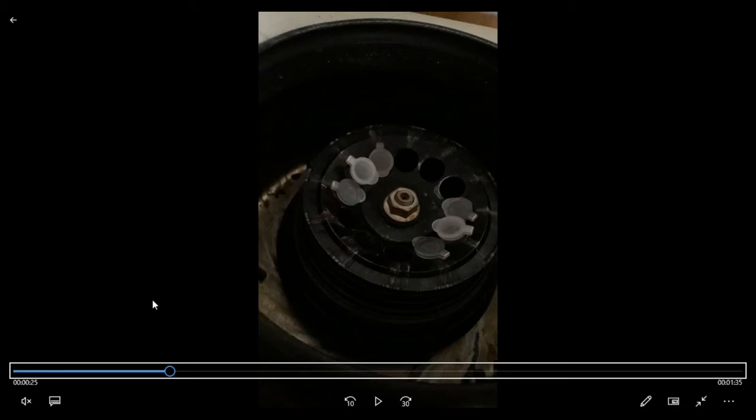if these tubes are not in a symmetrical or even position, the centripetal force will be irregular at the places where they are not symmetrical. That's why you have to place these tubes symmetrically and in an even number. If you do not have enough samples and can place only one tube, you fill another tube with water or any other solvent to maintain the symmetry of the placement. Then you place centrifuge tubes in these holes and proceed further.